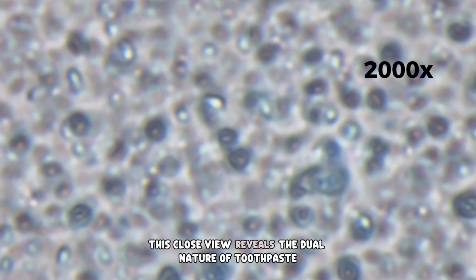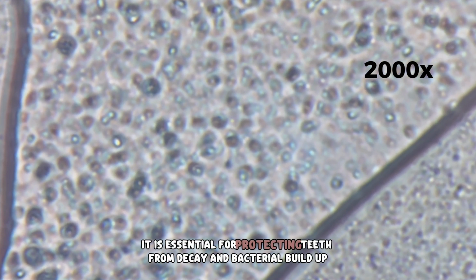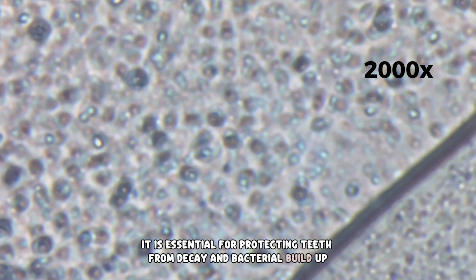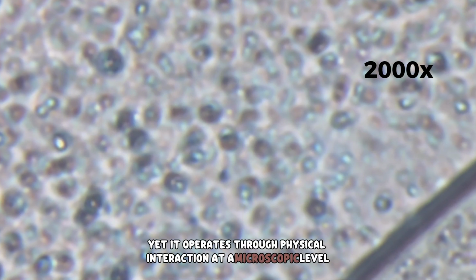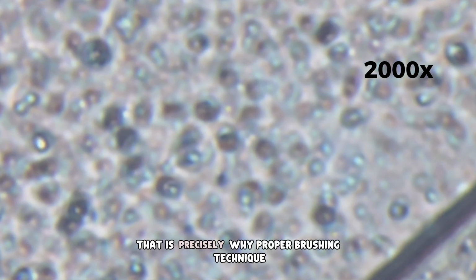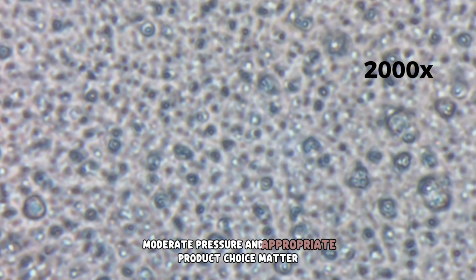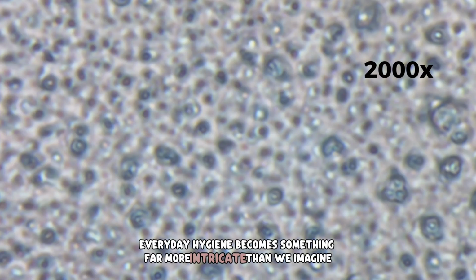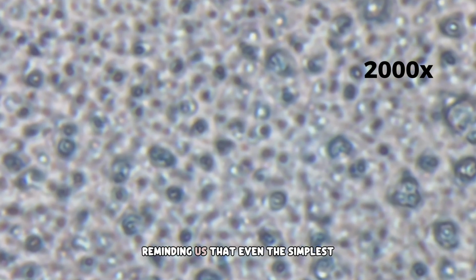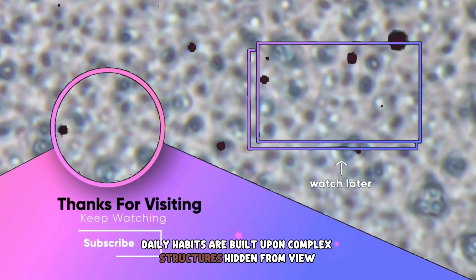This close view reveals the dual nature of toothpaste. It is essential for protecting teeth from decay and bacterial buildup, yet it operates through physical interaction at a microscopic level. That is precisely why proper brushing technique, moderate pressure, and appropriate product choice matter. Under magnification, everyday hygiene becomes something far more intricate than we imagine, reminding us that even the simplest daily habits are built upon complex structures hidden from view.